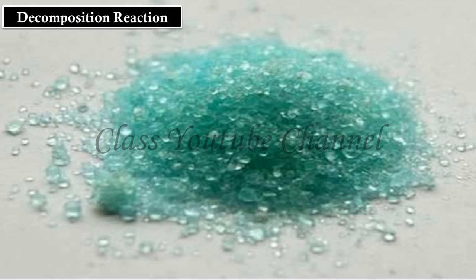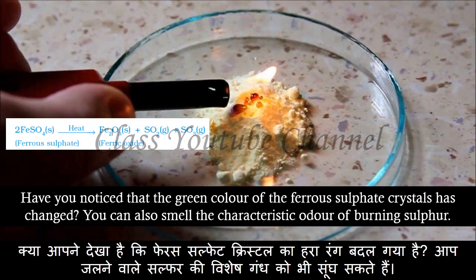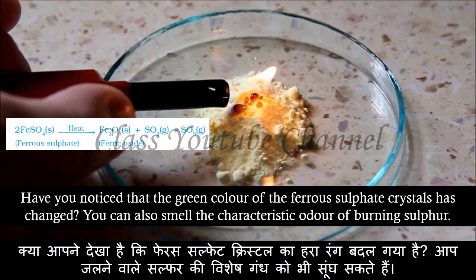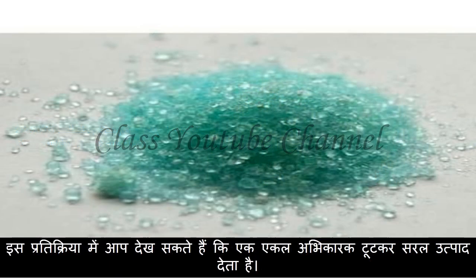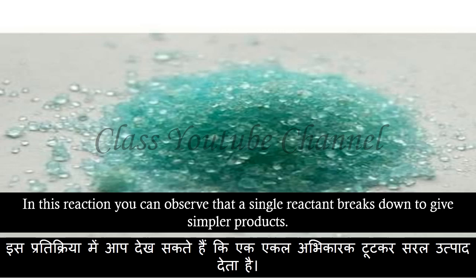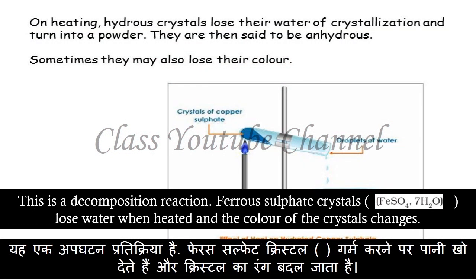1.2.2 Decomposition reaction. Have you noticed that the green color of the ferrous sulfate crystals has changed? You can also smell the characteristic odor of burning sulfur. In this reaction, you can observe that a single reactant breaks down to give simpler products. This is a decomposition reaction.